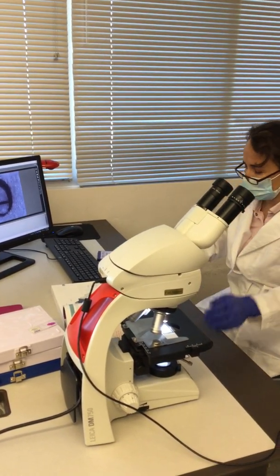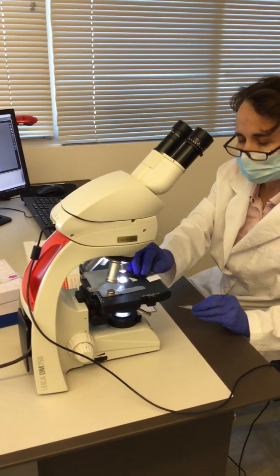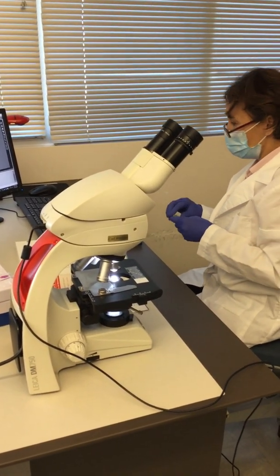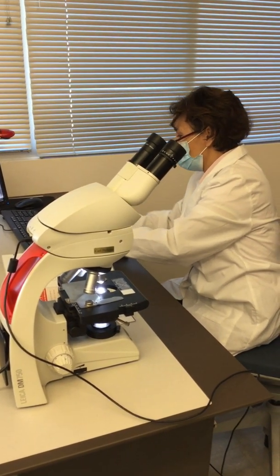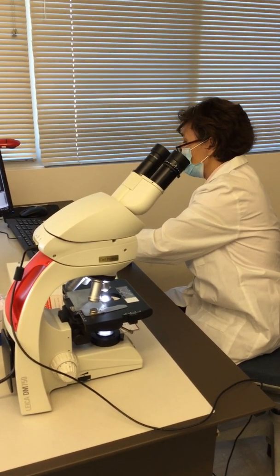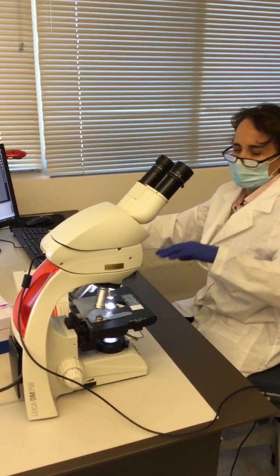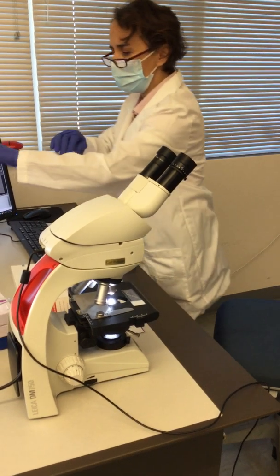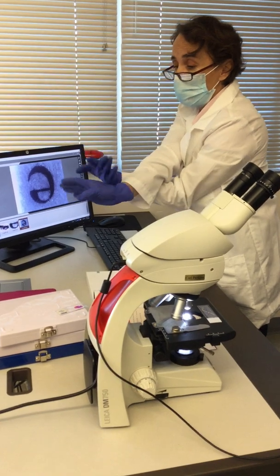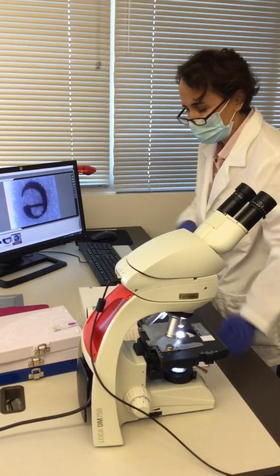So let me change the slide and then we will see how they look. In this case we have blue, yellow, and red threads, and since they're thick and they are on top of each other, they're at different levels or planes. It's something like this. So you have one thread in here, you have the other one on top, and perhaps they're tangling like this, and then you have another one. So they are located at different depths.